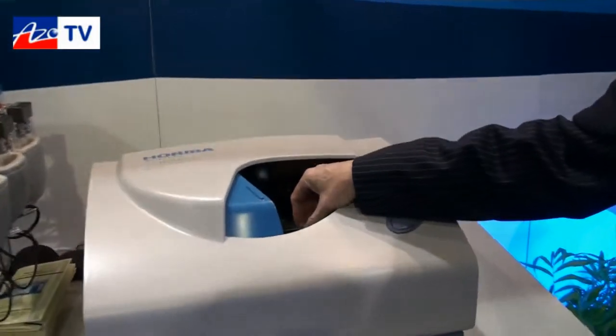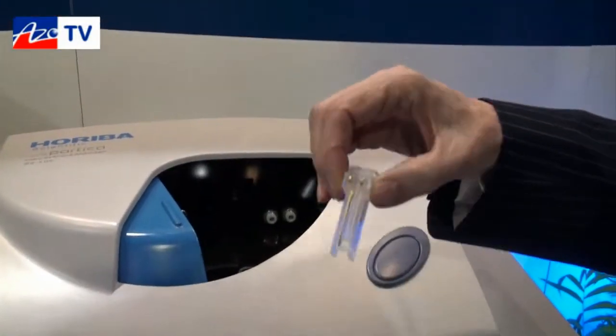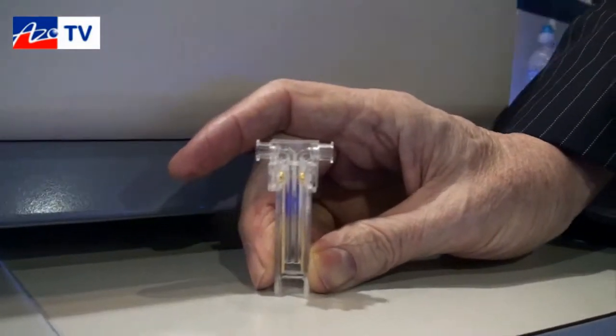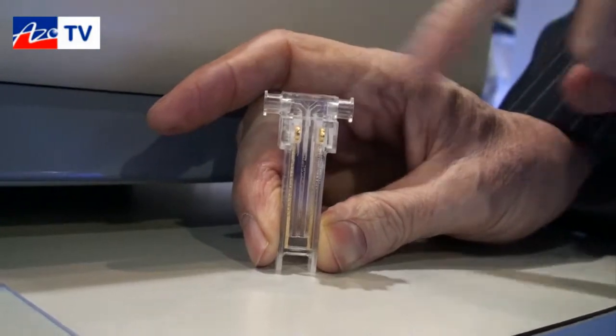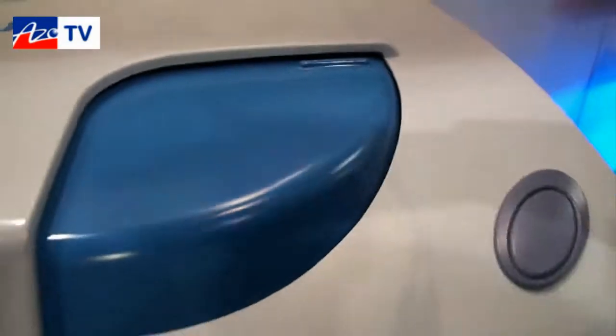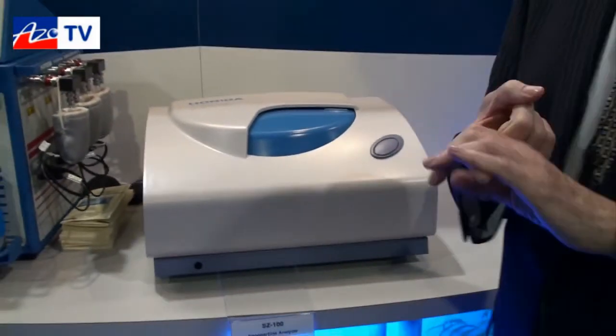The measurements are very easy. Inside the sample chamber we just have two cells. This is actually the zeta potential cell, not the particle size cell, but for a particle size measurement we would take either a disposable or glass cell, enter the sample into the cell, and then simply place it into the instrument chamber and initiate the measurement with the control software. Installation is just a single cable to the computer, and the measurement takes just a minute or two. Sample preparation could be a little more involved, but we've made the measurement as easy as we possibly can.